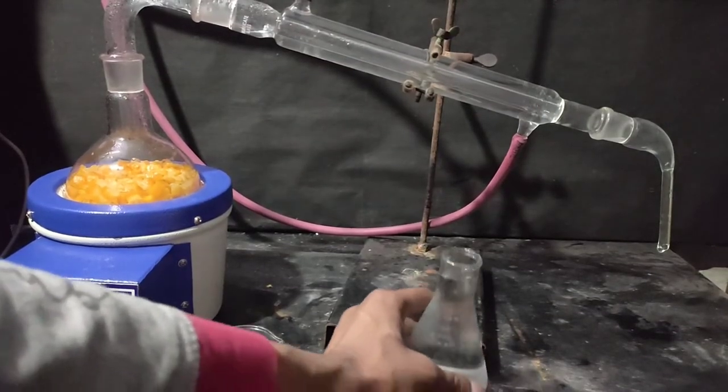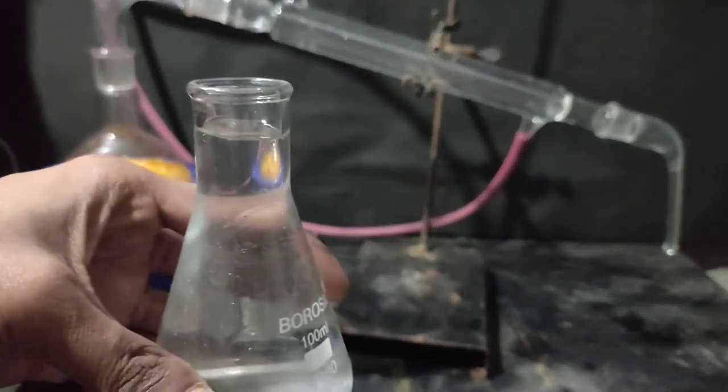Even after collecting more than hundred ml of distillate, I could not see any oily layer on water.